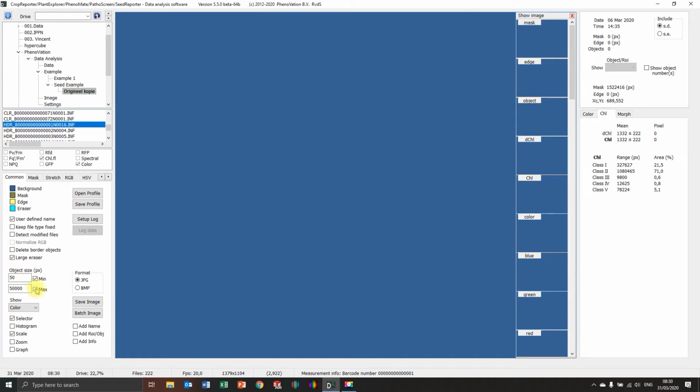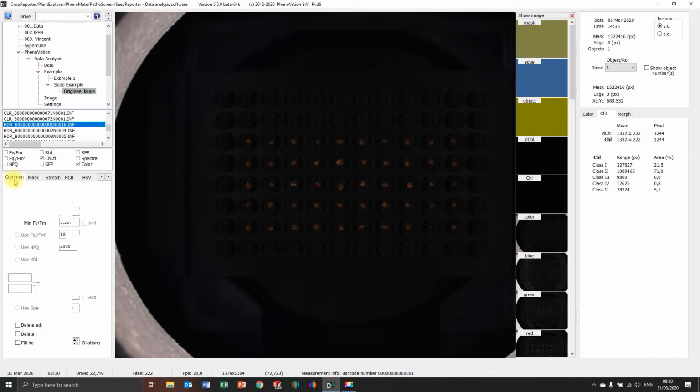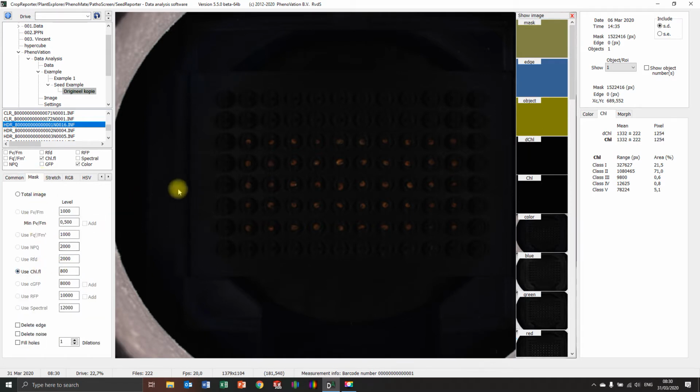still nothing. I will also delete the mask, this one. You see, there you have some, it's back again. So this is good. So we have switched on the mask on chlorophyll. I changed this and we see something. But you also still see the entire picture because I have the mask on 800 and you already see that the background noise is 1200. So we have to at least be bigger than 1250-ish. So let's say 1300.